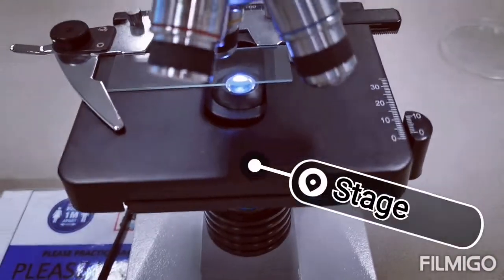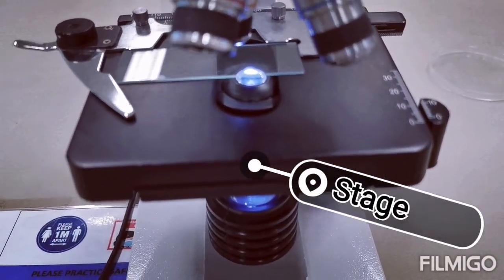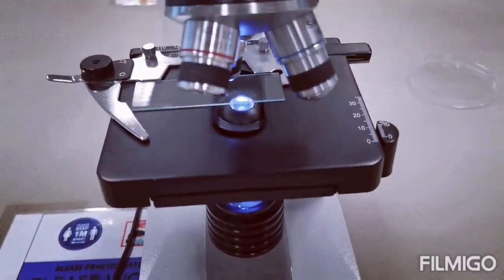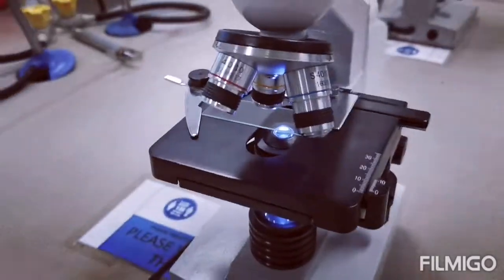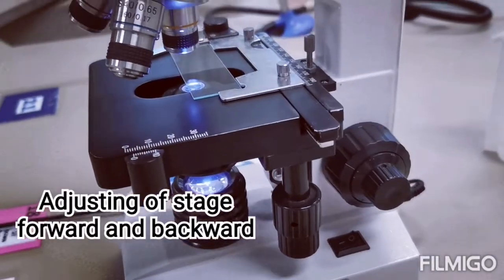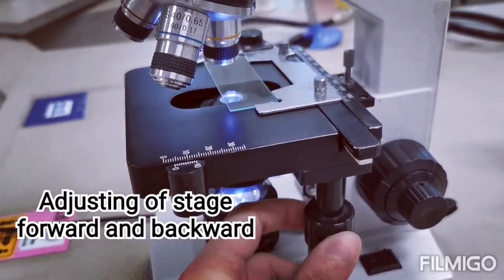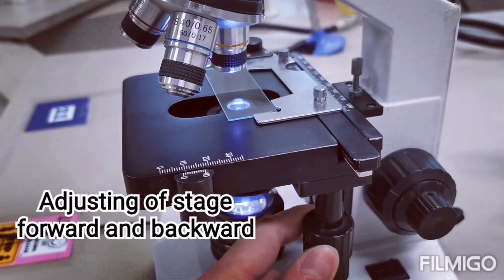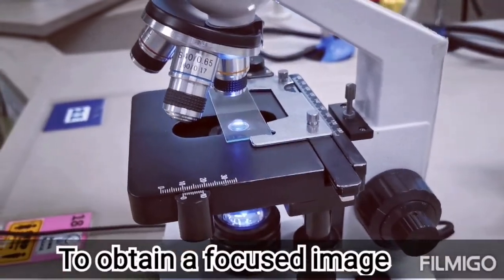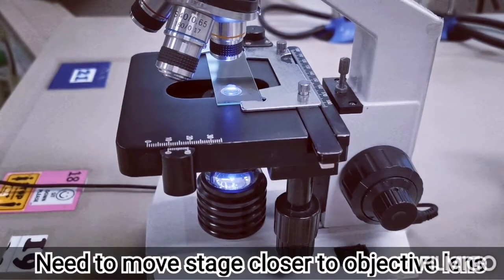Next up, this is the stage where you will mount your specimens on the slide in order to observe under the microscope. Moving to the side, this knob is the one to look out for if you would like to adjust the stage forward and backward. To obtain a focused image, we need to move the stage closer to the objective lens.